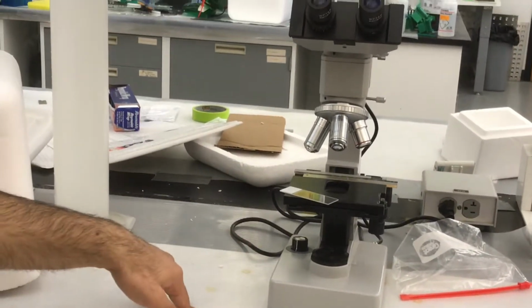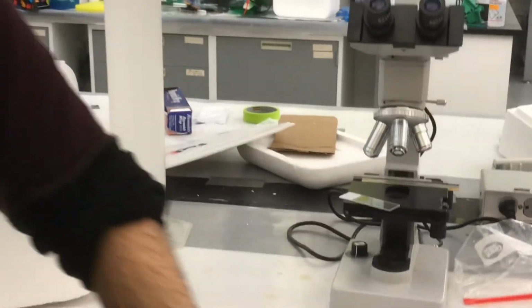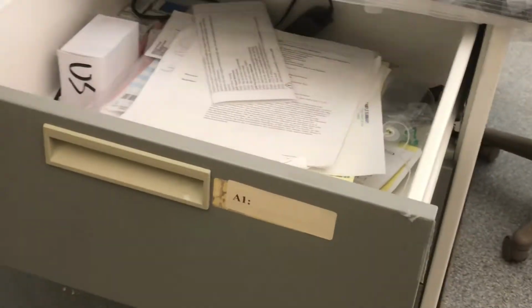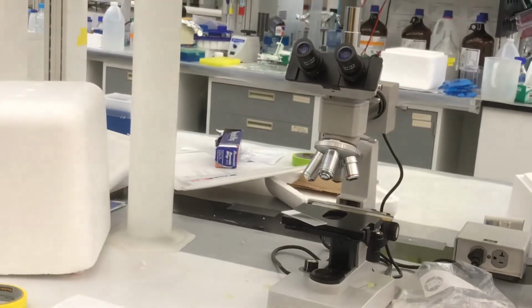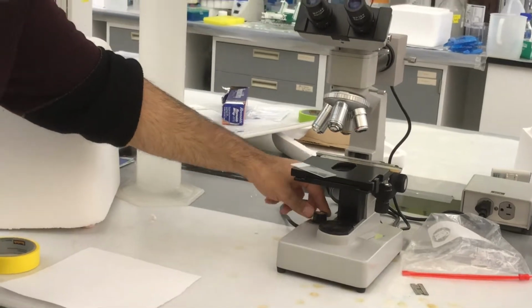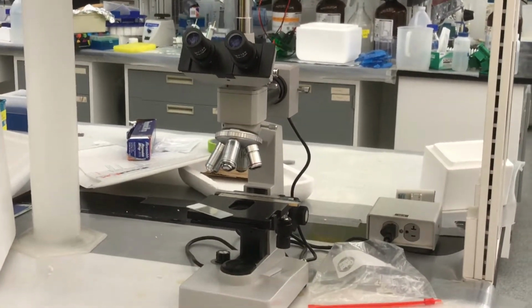You can also see the silicon wafer in this. Yes. And we can also take a video with it. For taking video, we have the camera, and I will show you how to use it when I prepare the master mold. This is very easy. Just turn on the microscope, turn on the light, and then you can see.